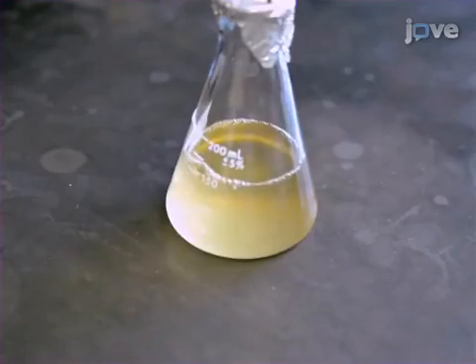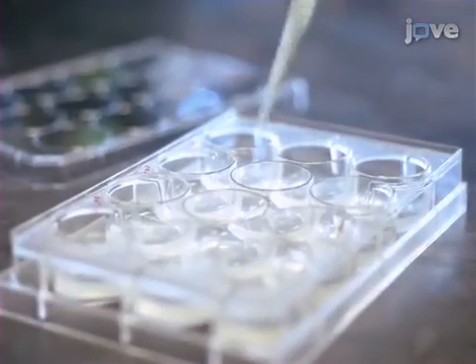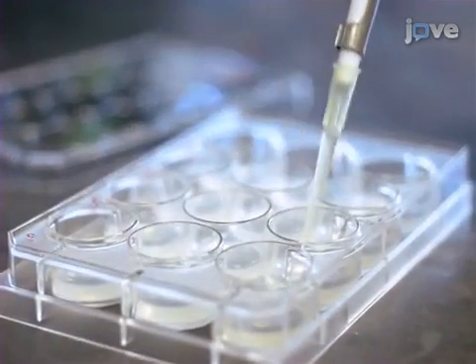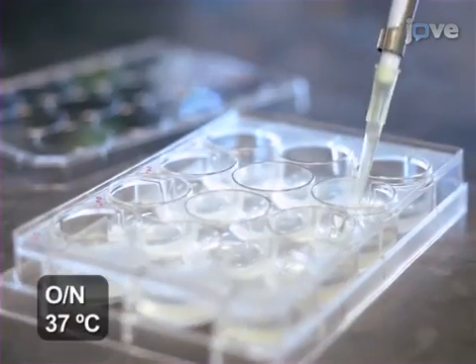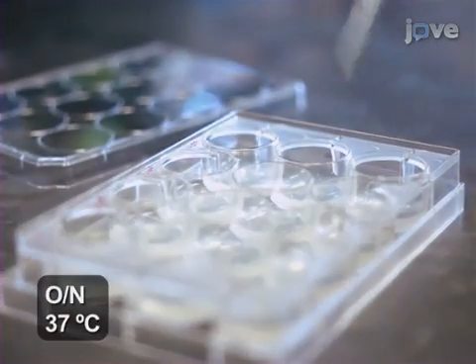The next day, into each well of the prepared plate, add 20 microliters of the bacterial culture. Set the plate to incubate overnight at 37 degrees Celsius.